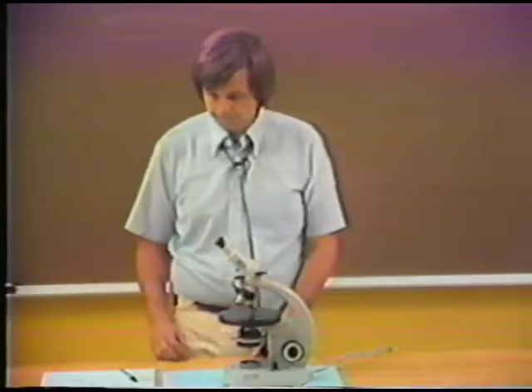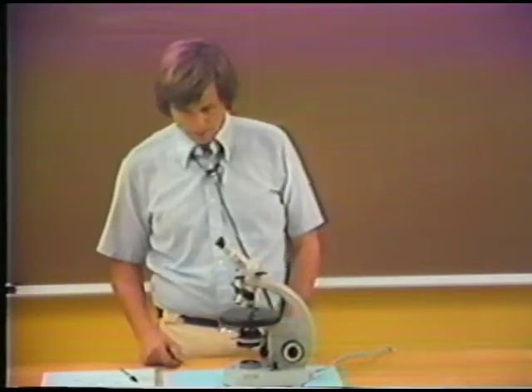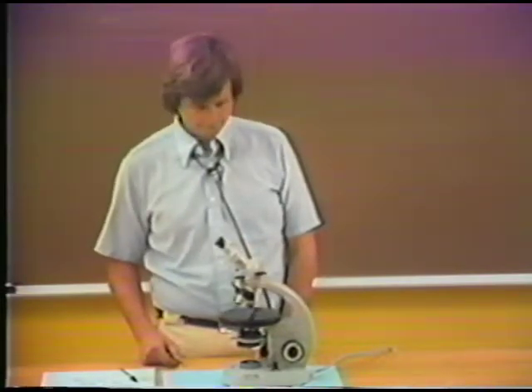You can see the hexagonal form of the tourmaline in these C-axis sections, where the C-axis is perpendicular. You can see the hexagonal prismatic kind of form that tourmaline exhibits. So we need to look for expressions of form for each mineral unknown, because these can offer us information about its identification in the same way as color or pleochroism does.